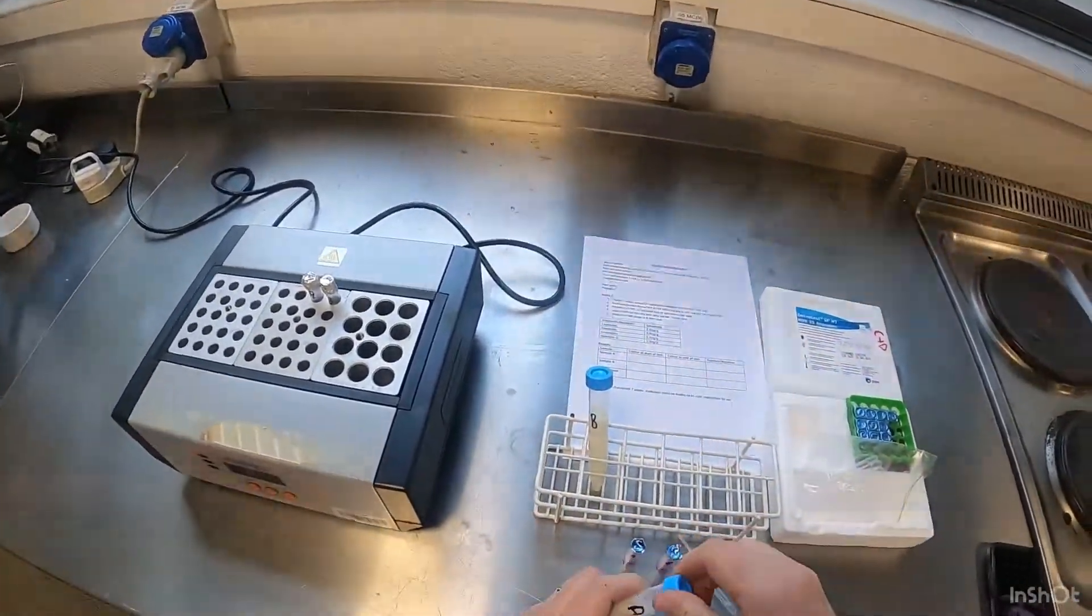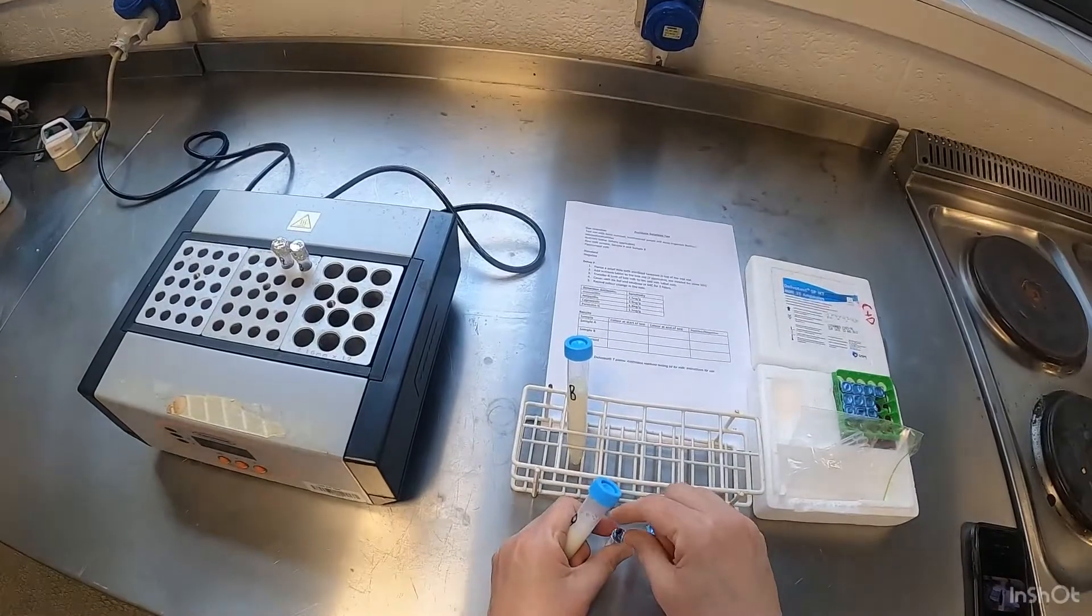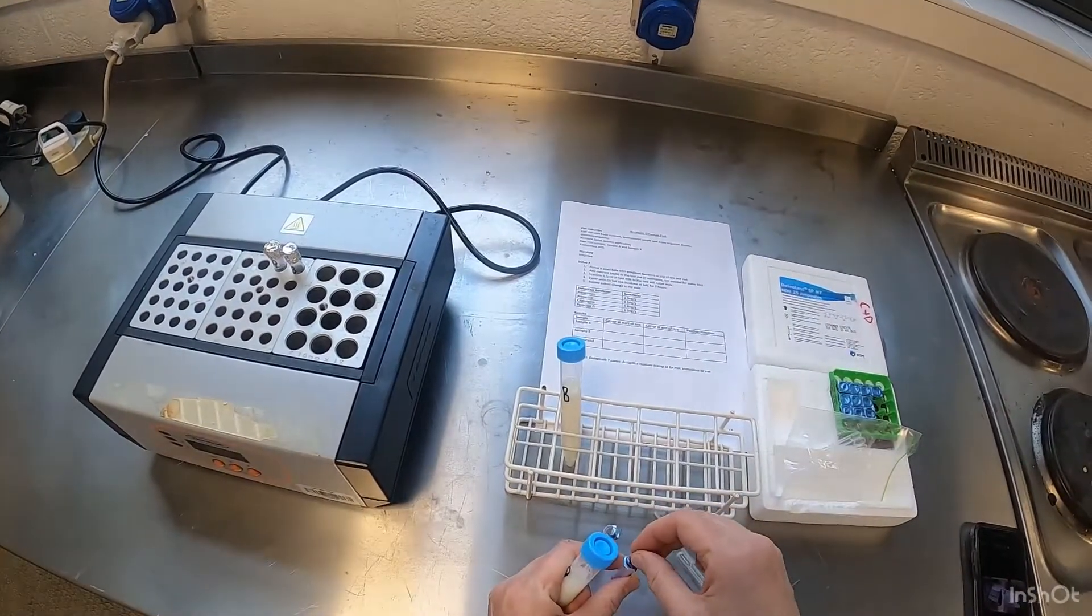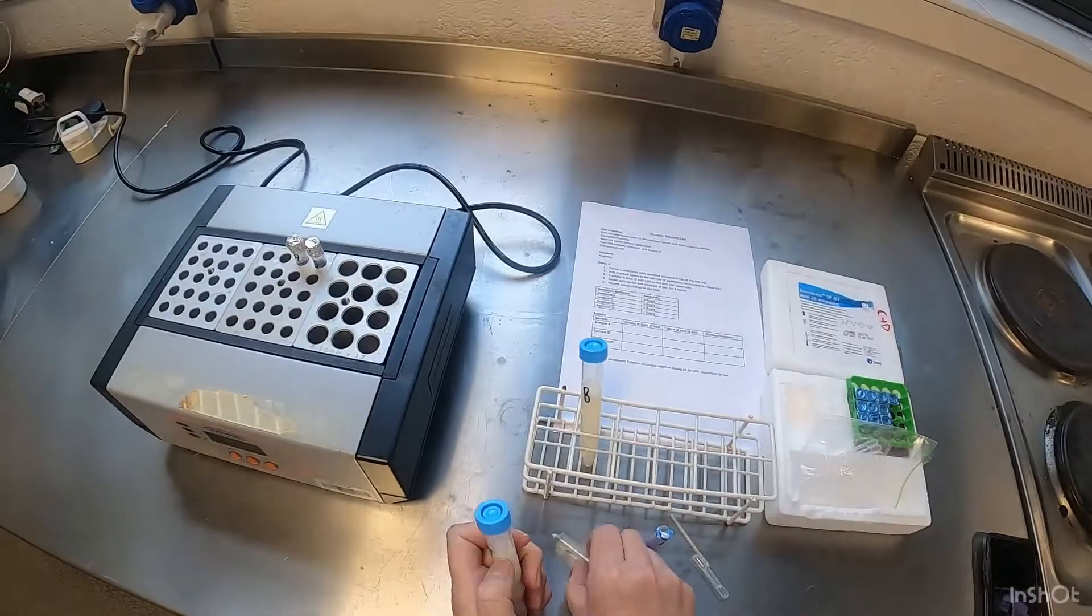I'm just going to take sample A and give it a little shake there, and I've pulled back the foil on both those samples there.